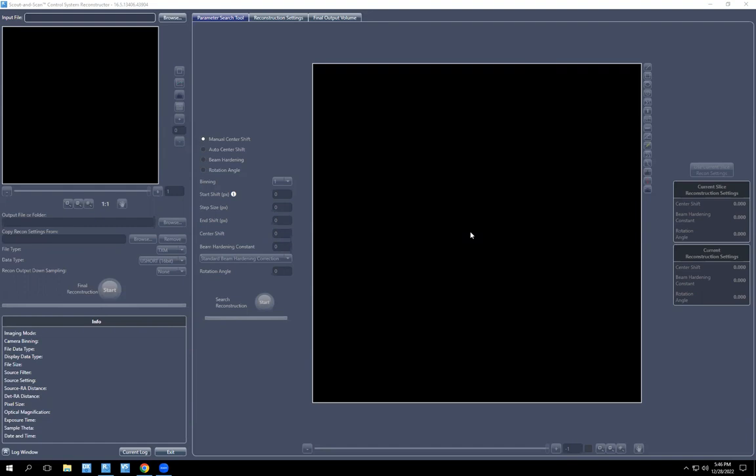How to reconstruct your data manually, when your automatic reconstruction has failed or has not produced a result that you like.